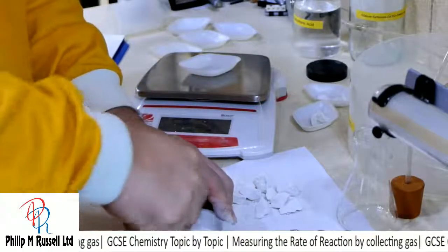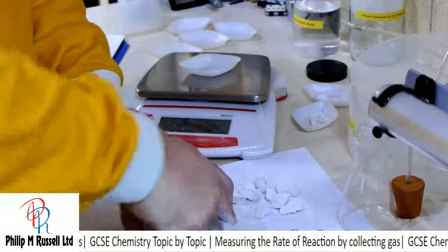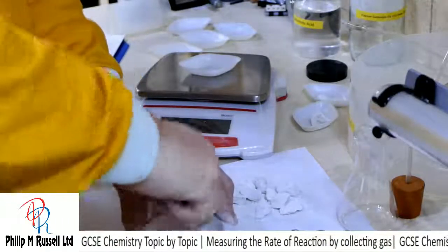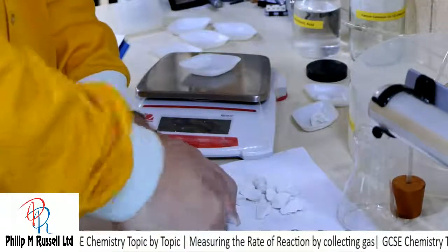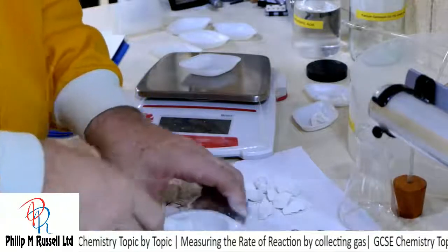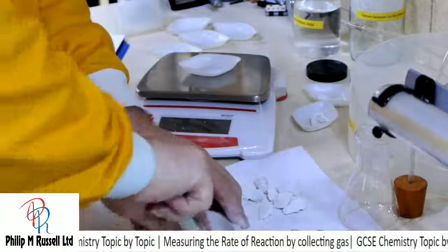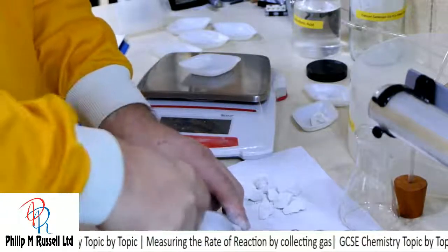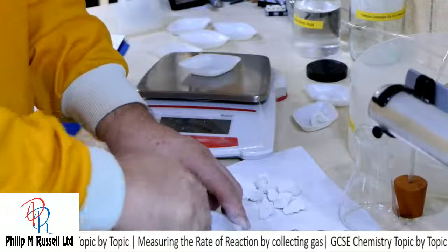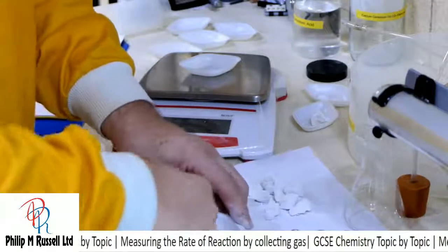So we'll now break this up into small pieces, really small. So this is sort of a powder, and I'm doing this by twisting as I do this. And as I twist it, it grinds it. It's much better than trying hammering it. Hammering it doesn't work and basically just breaks things.